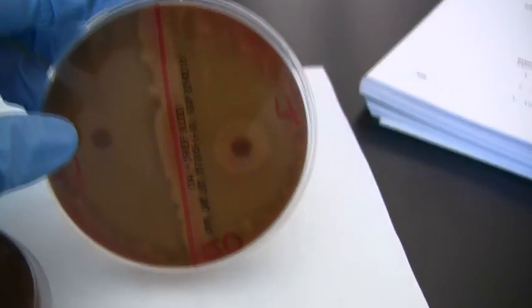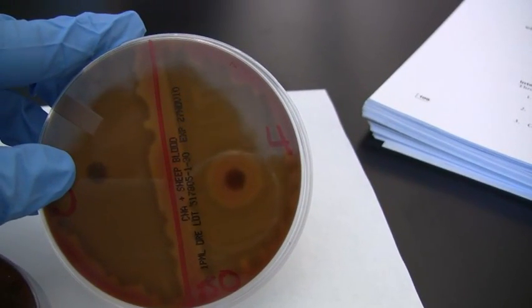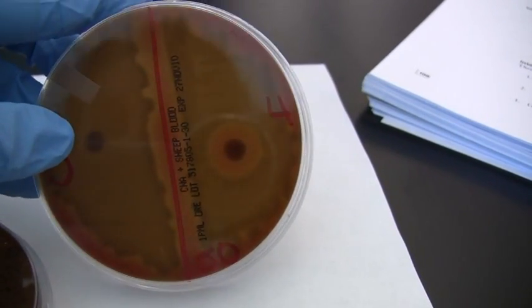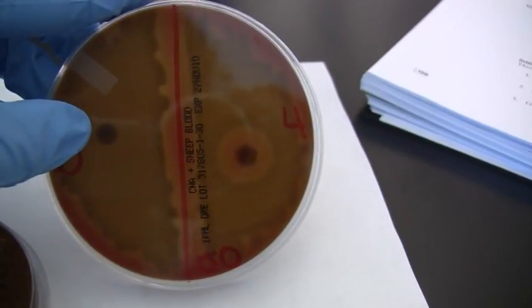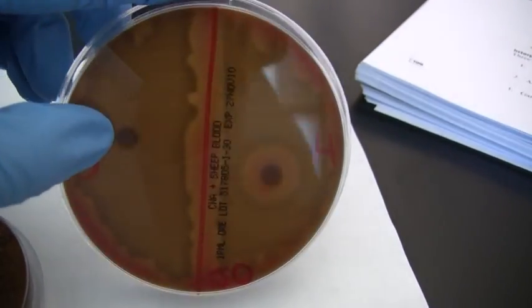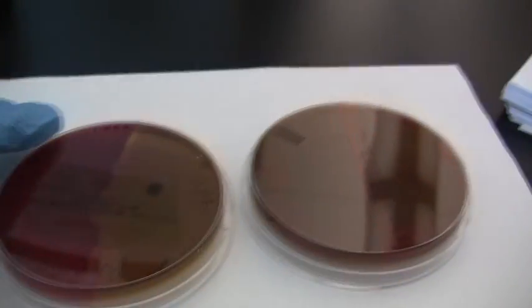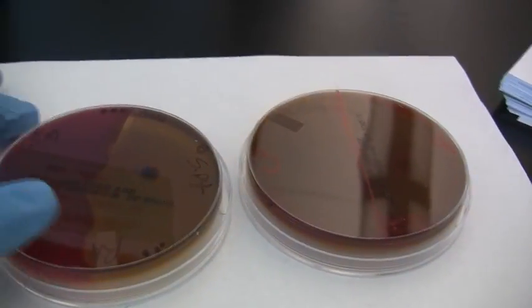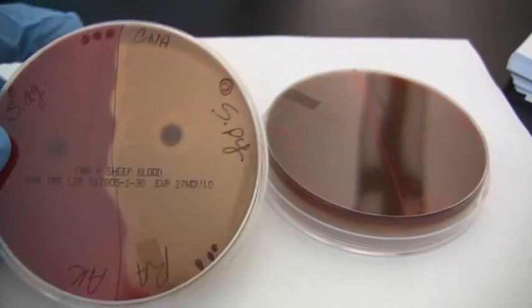The P disc, you're going to find, if you look at the key in your book, is going to be really helpful for distinguishing alpha hemolyzers from each other. There's only a couple of organisms that fall into the alpha hemolysis category, and so the P disc is going to really help you to start to break those apart. So again, just a quick recap on blood plates. You always want to make sure that you are looking from the bottom. I recommend holding it up to a light background.